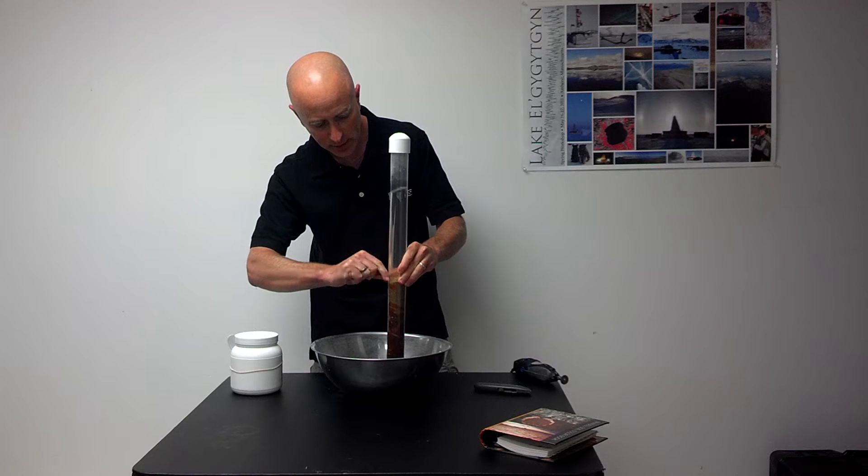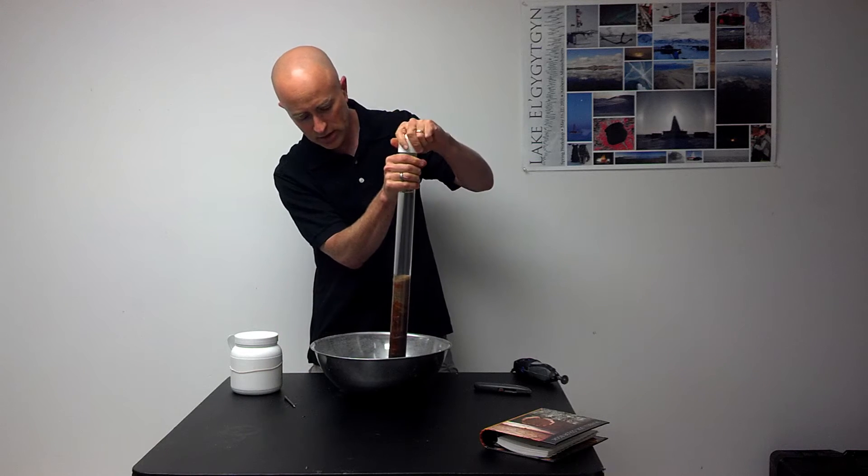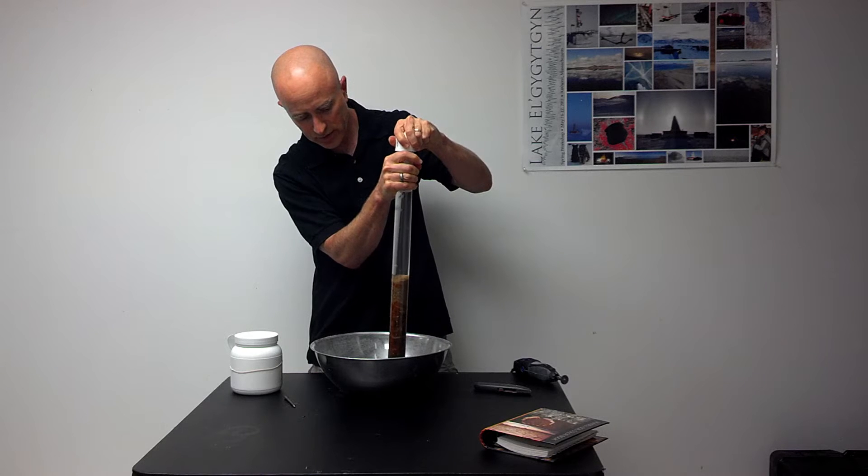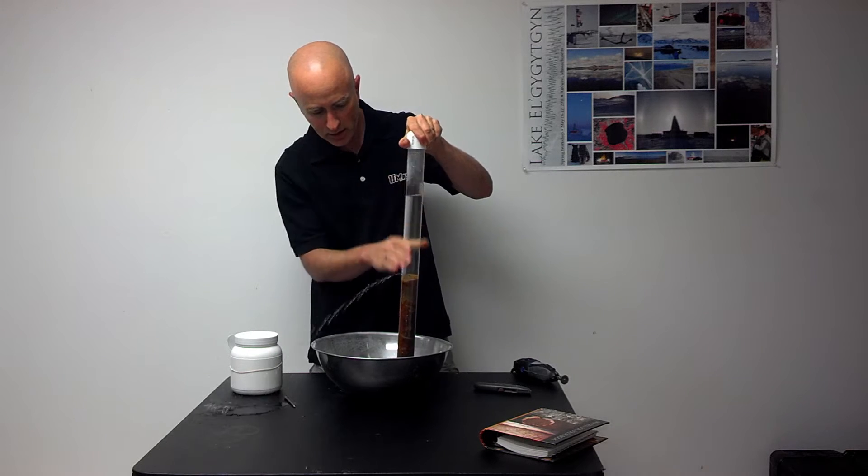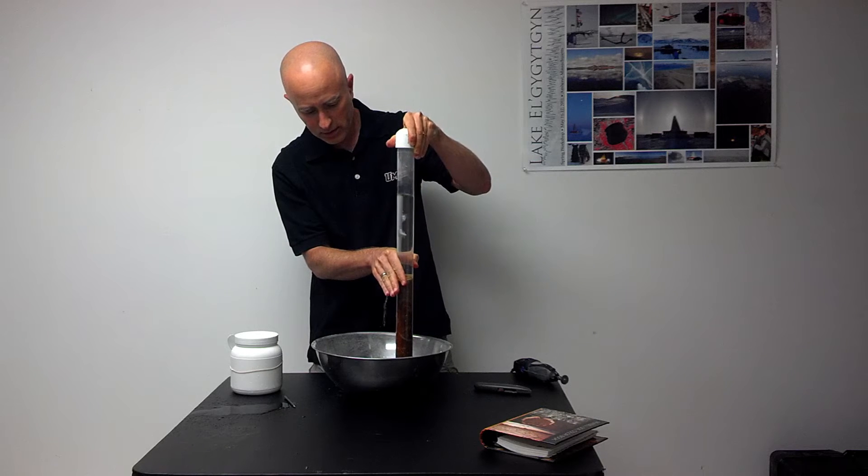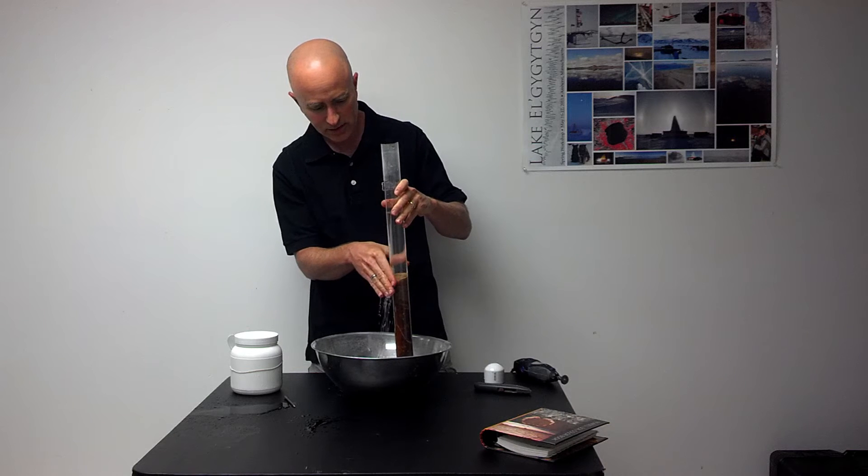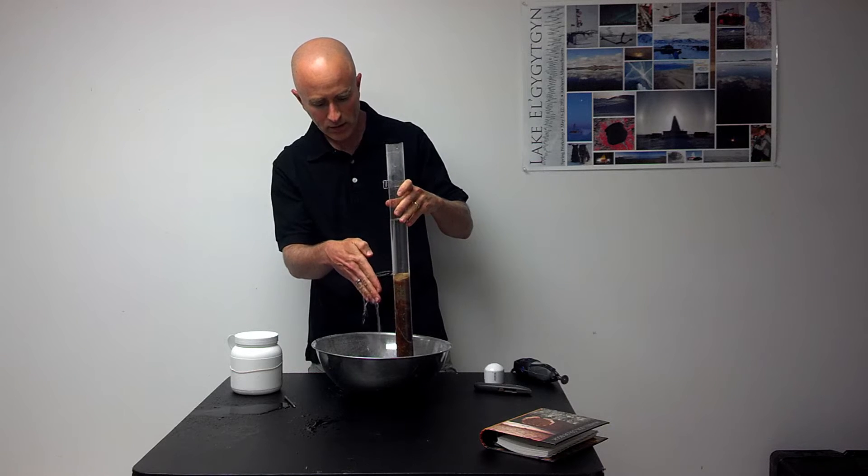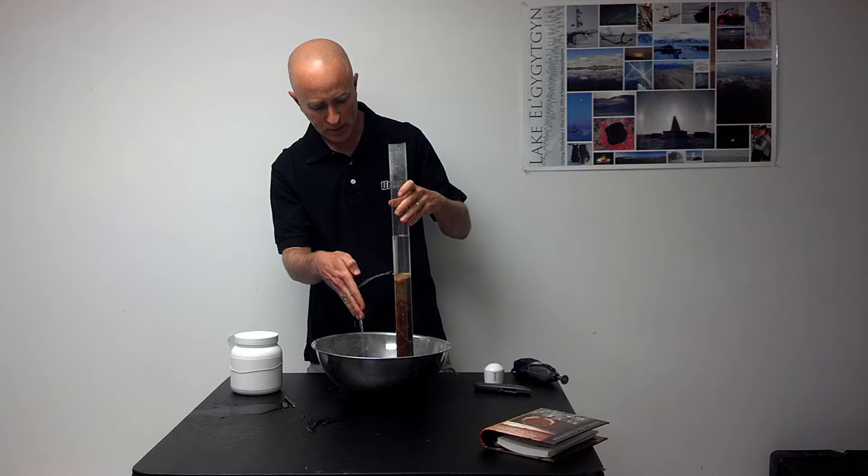Now I make this hole carefully, and it won't be until I start lifting off this top cap that it'll start to drain out. You need to be careful here because it's going to make a little bit of a mess. We just need to drain out the water from the top of the sediment.